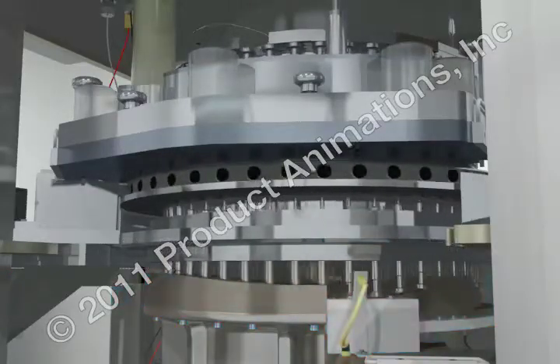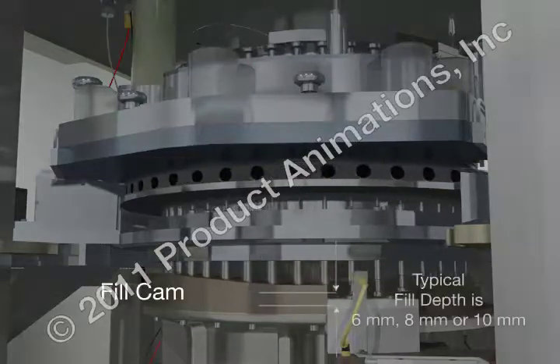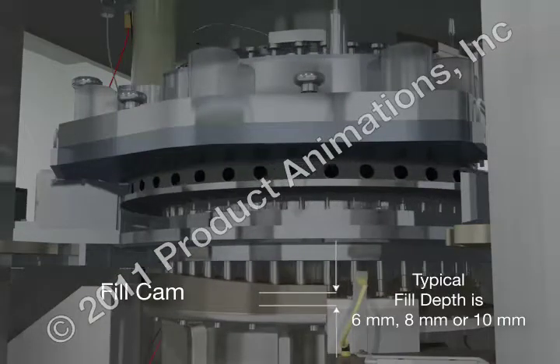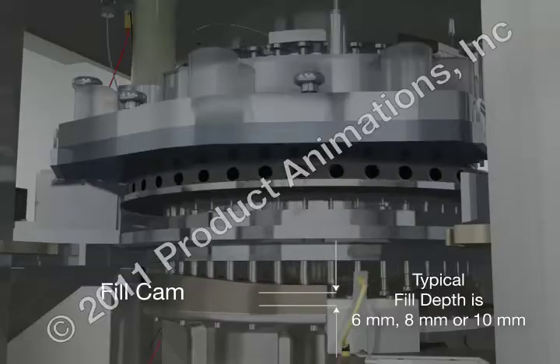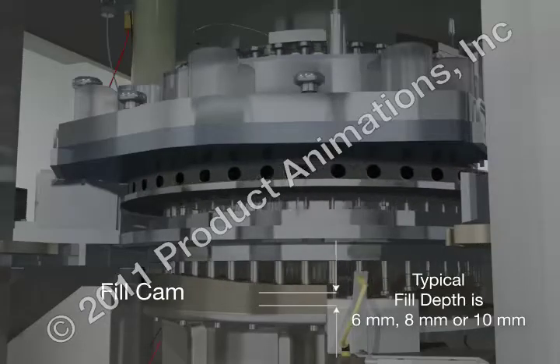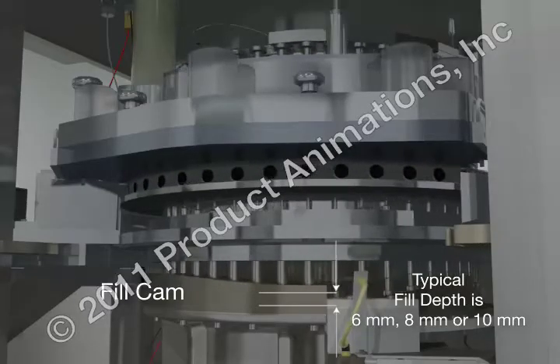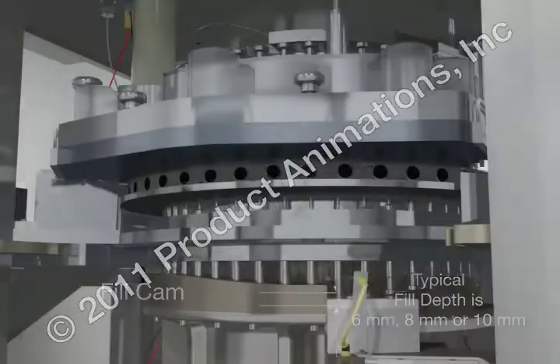The fill depth is controlled via the fill cam, which is interchangeable dependent on the desired tablet weight. As the lower punches travel through the fill cam, granulation is drawn into the dies.